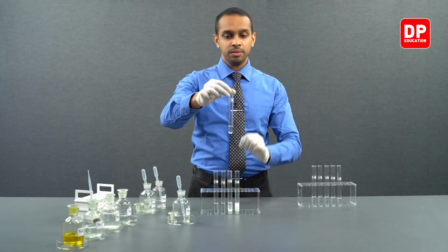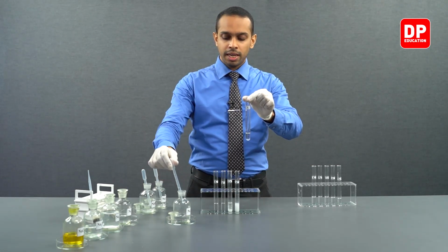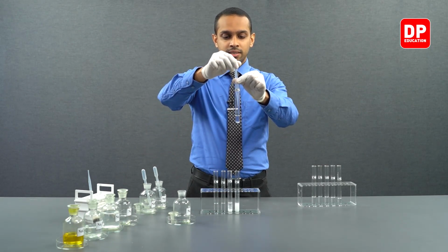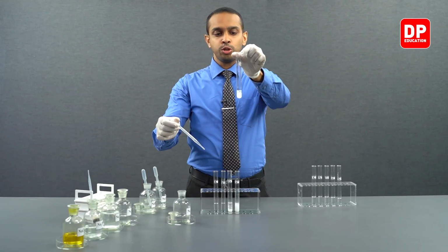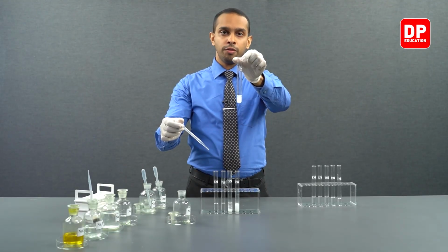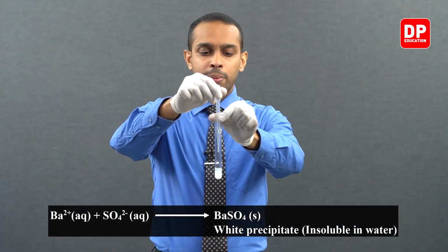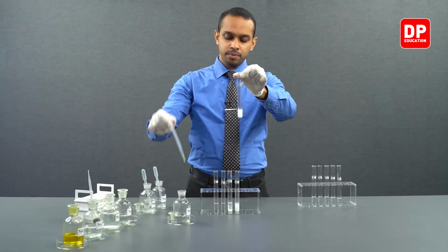Finally, we have our barium 2 plus aqueous ion solution. Let's take our barium 2 plus aqueous ions and add a small amount of sulfate anion. As you can see, as soon as even a drop of the sulfate anion solution was added, a white color precipitate was formed. Let's add a few more drops.